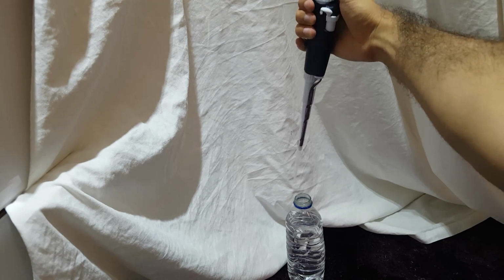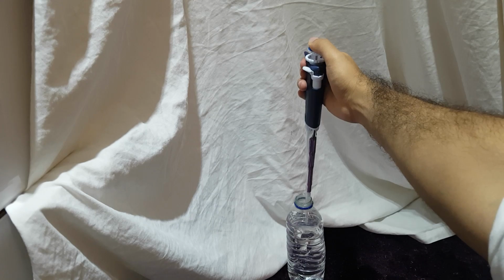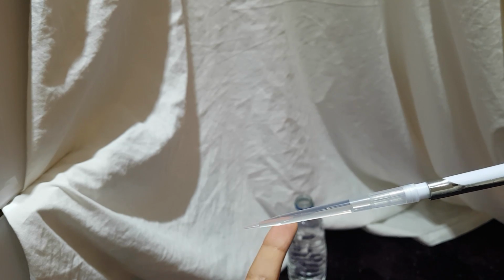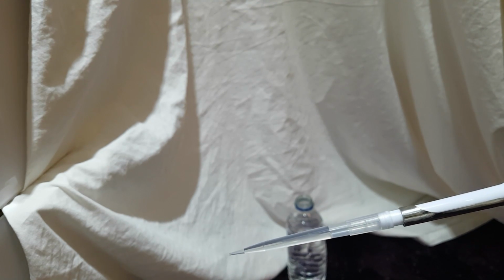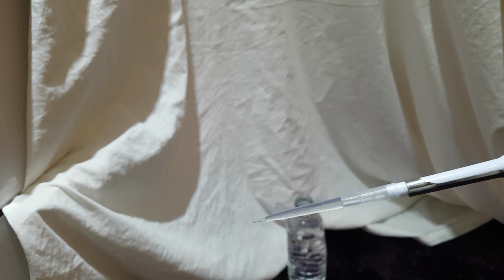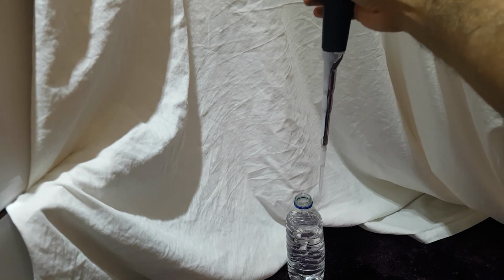Now, you lower your tip into the liquid, as you can see, you slowly bring the plunger up. Right, let's have a look. As you can see, we clearly have some liquid in here, and that liquid is exactly 750 microliters. Now, we want to expel this fluid back. For example, we want to put it in a well, or we want to put it into our culture, or into our solution. So, let's show you how to do that.